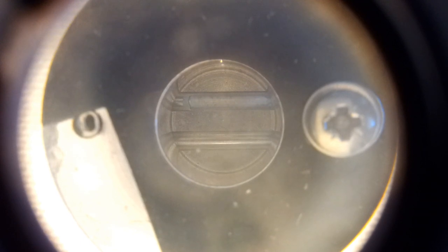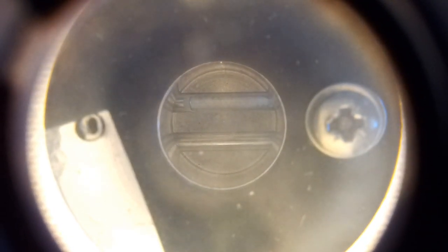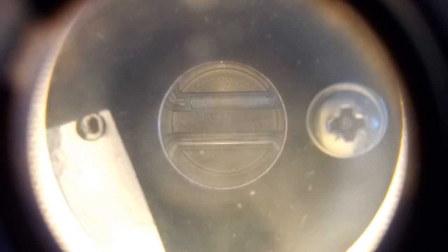So we'll start heating. The temperature is now at 132 degrees, and you can see that it's starting to melt, 133 degrees.